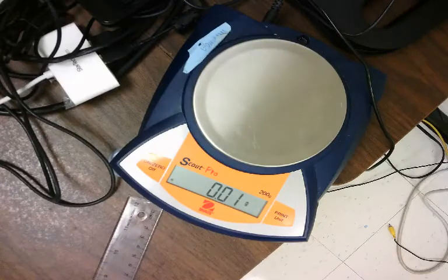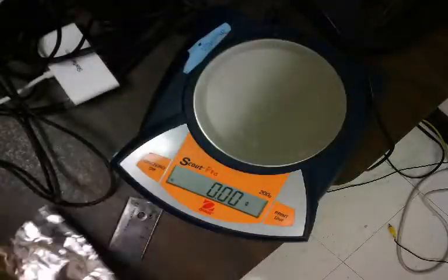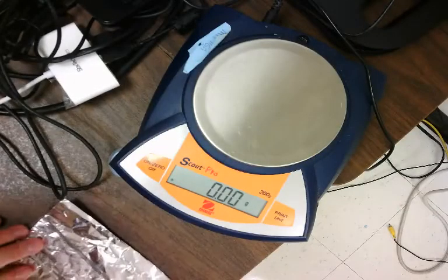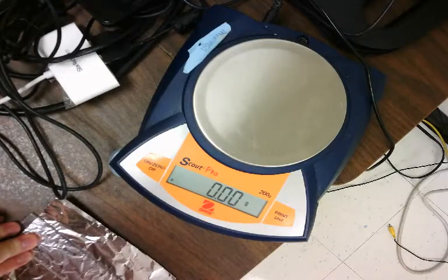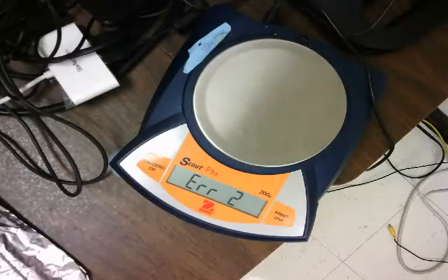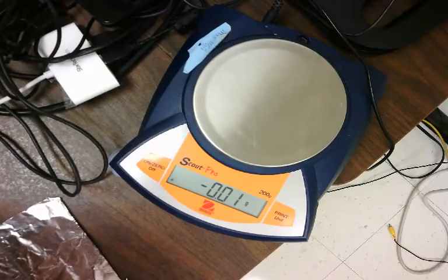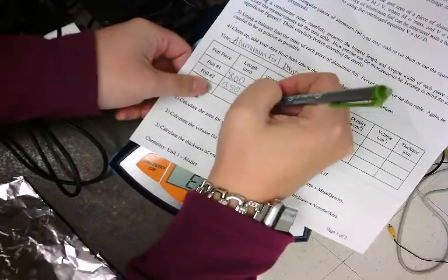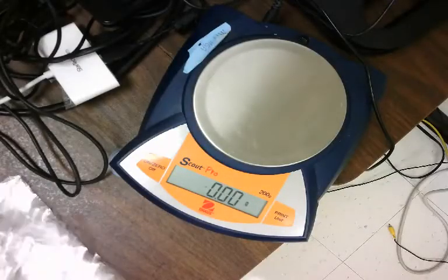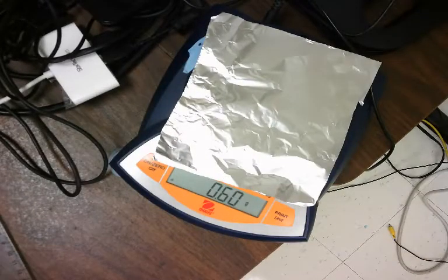My second piece — I've zeroed out the balance. Measuring in centimeters: the length is 13.50. For foil number two, length 13.50. The width is 14.70 centimeters. Now let's find the mass — making sure the balance is zeroed out — 0.60 grams.